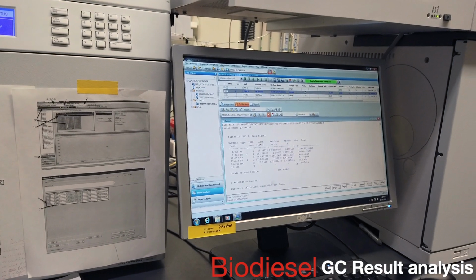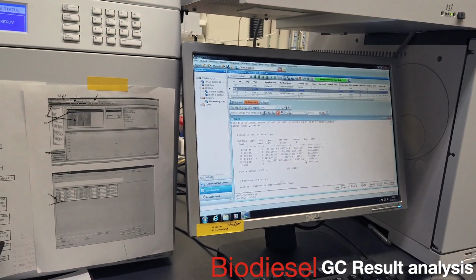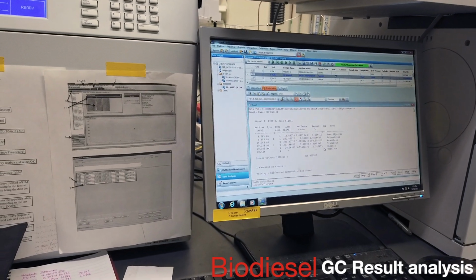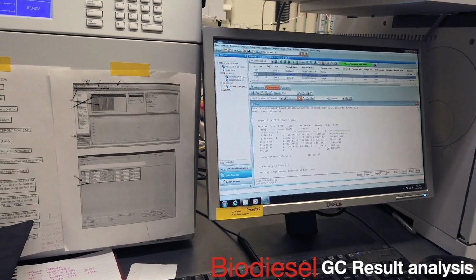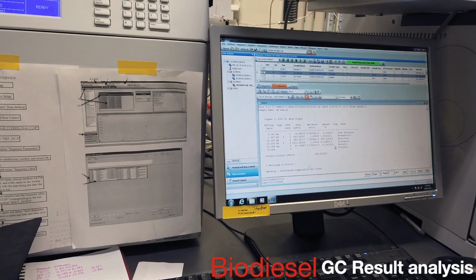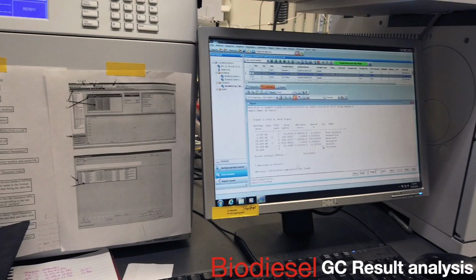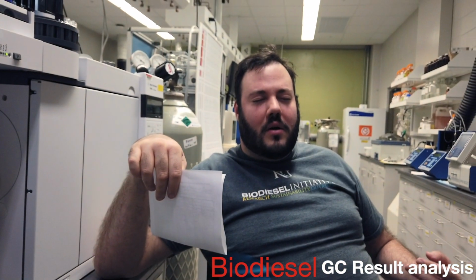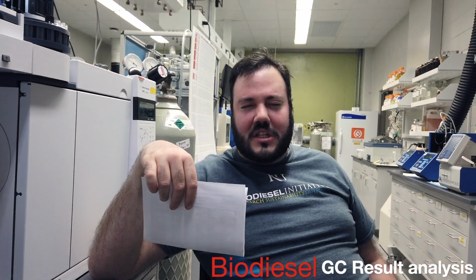You can buy glycerides and dilute them in, maybe, pyridine, and then shoot that. If it overlaps directly, then you know. But that's also assuming your free fatty acid composition is the same, which, when you're doing used cooking oil, is not going to happen. Right.